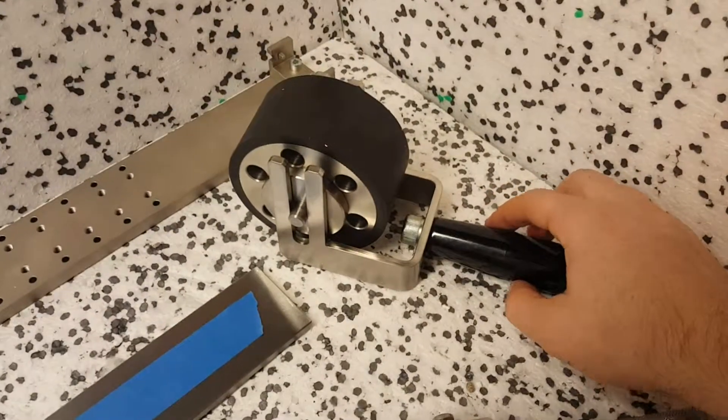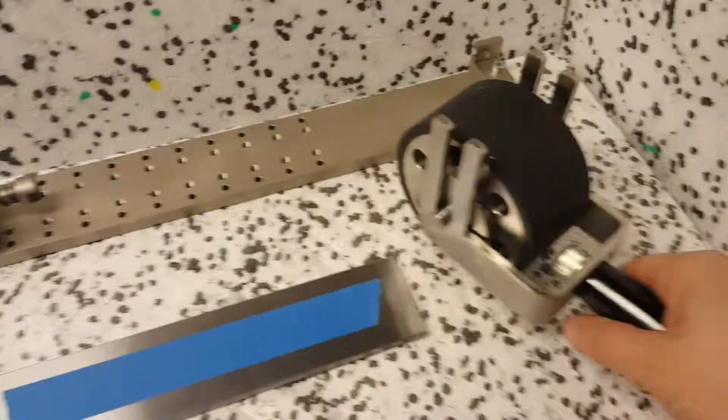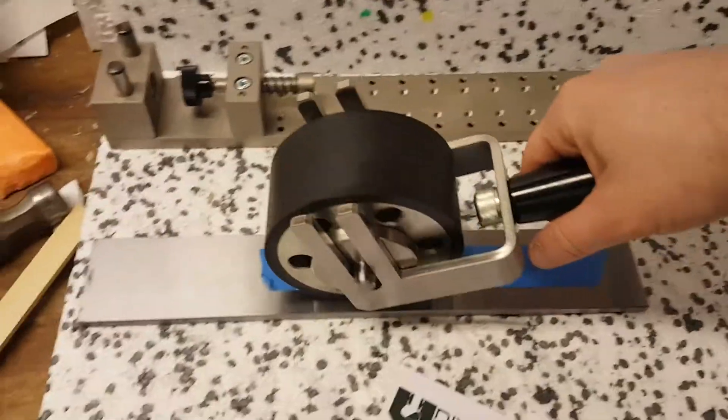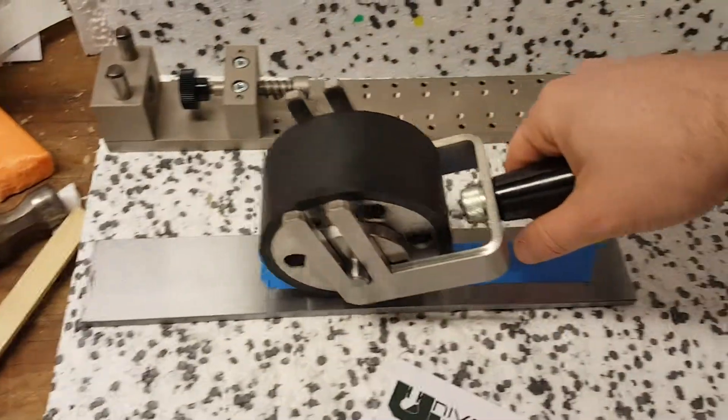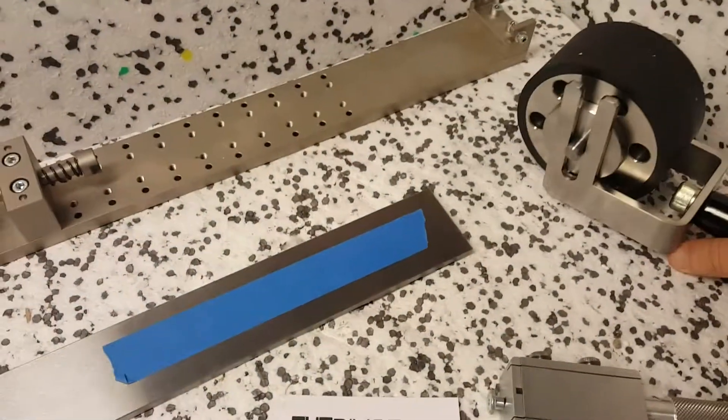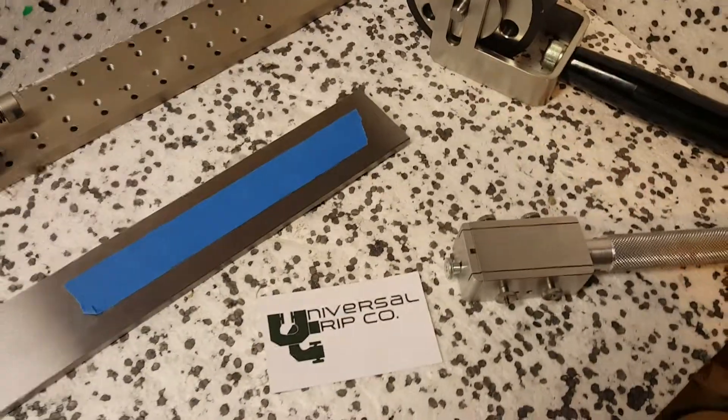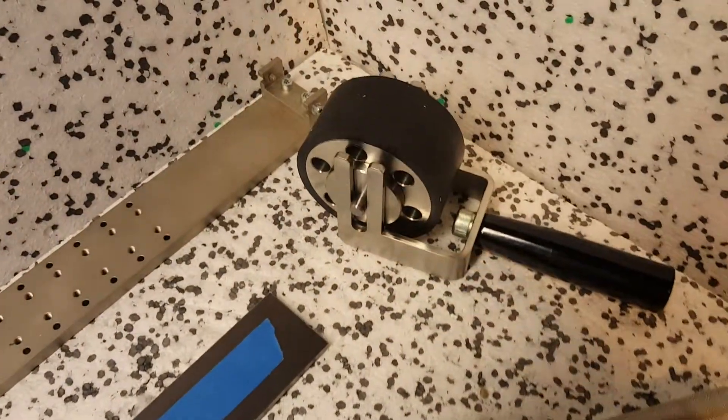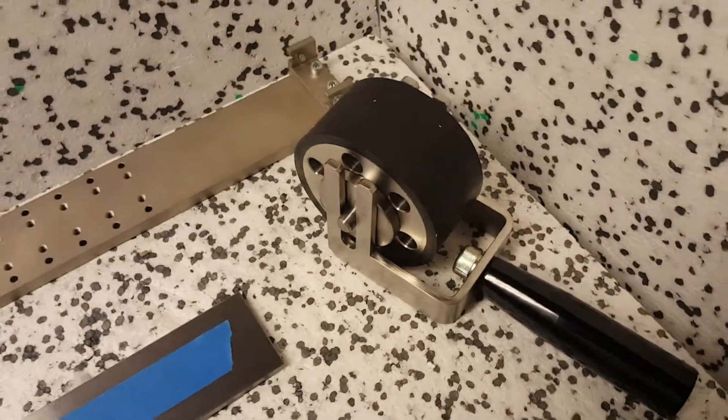To use this, you just put the tape on and then roll over it. Some people roll once, and some others roll forward and backwards like I just did. So again, this is our weighted roller.